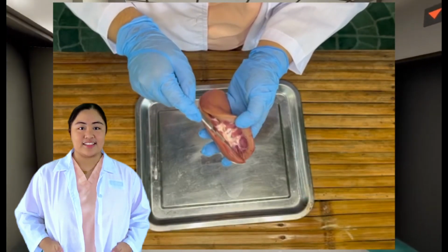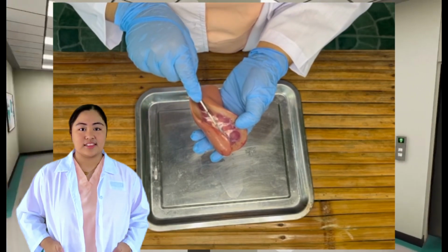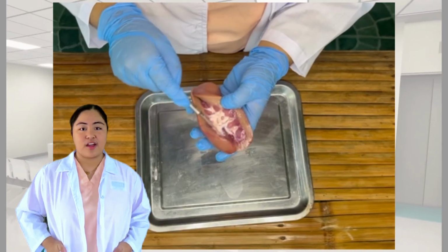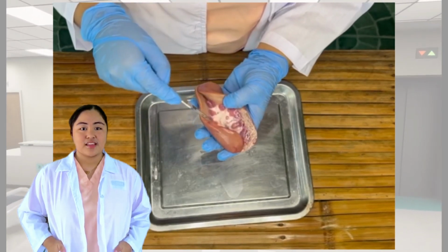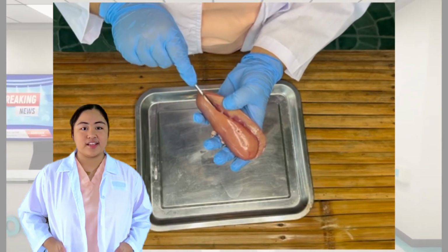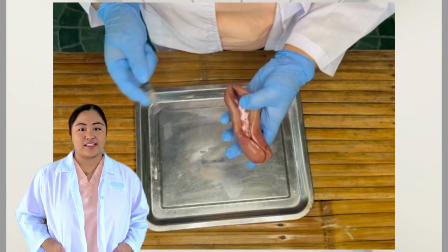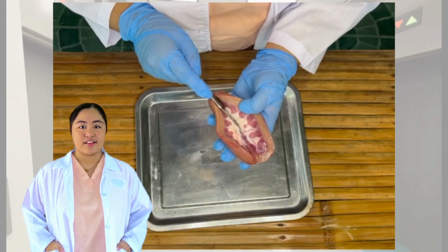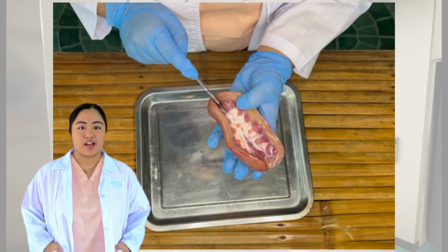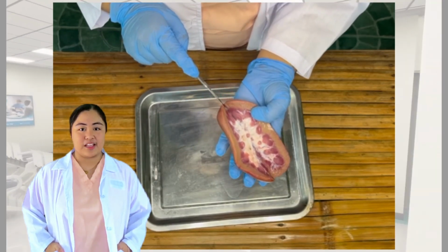Now let's cut this kidney open. We will perform a frontal or coronal section so we can have a nice view of all the structures of the cortex and the medulla. This way, we will be able to see the pathway taken by urine upon its formation and up to its excretion by the kidney. As you're cutting along the kidney, do not be afraid to put your fingers into the cut to allow the scalpel to cut deeper into the medulla.